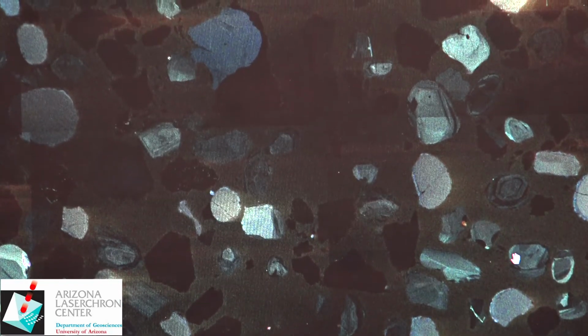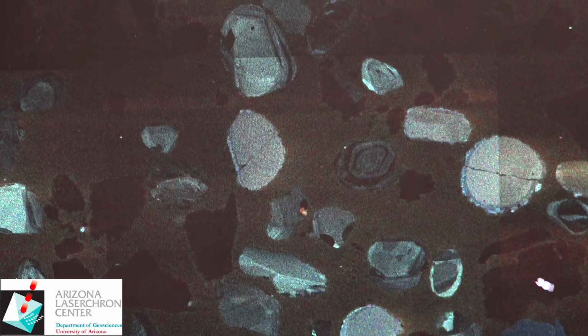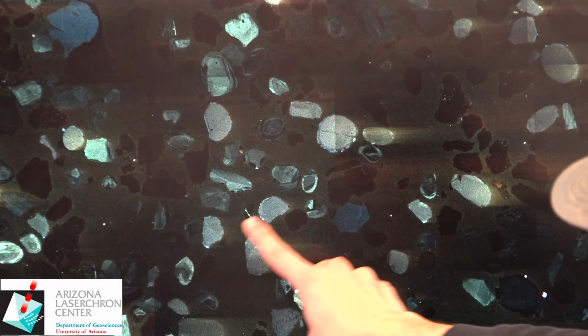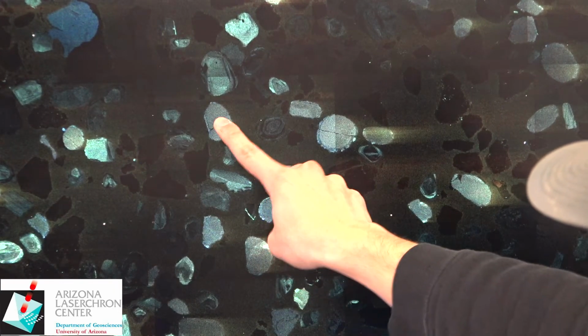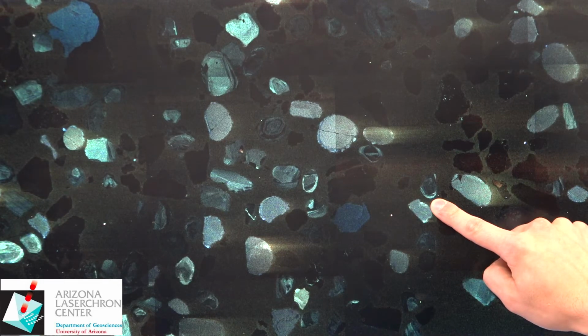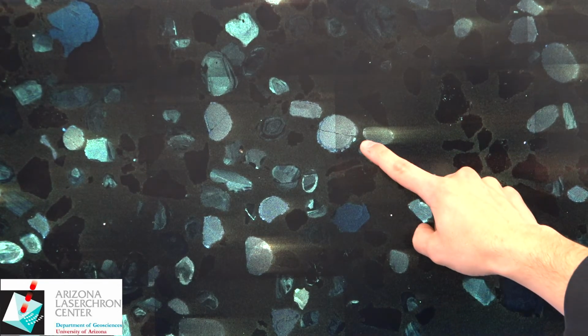So I'm pretty sure this is that area. If not, it should be pretty representative of the entire mount. So on the color CL, we can see a couple of interesting things. First, discussing zircon itself, you can see all of these blue and marginally green crystals are the zircon itself. A very soft pale blue, they could get to very bright blue, such as the rim of this grain right here. They can also be rather dark, which is more or less indicative of higher uranium concentrations.